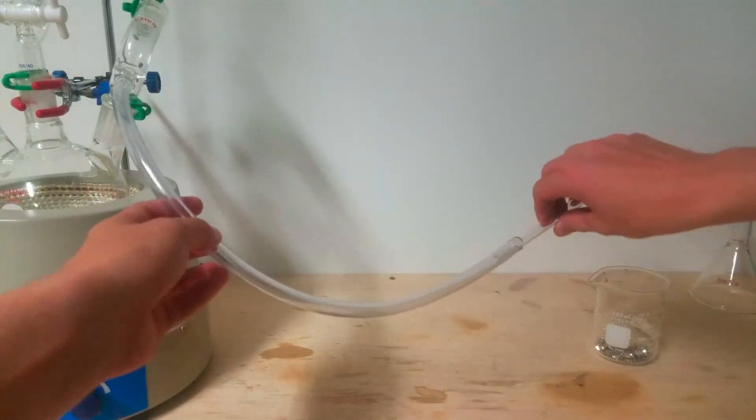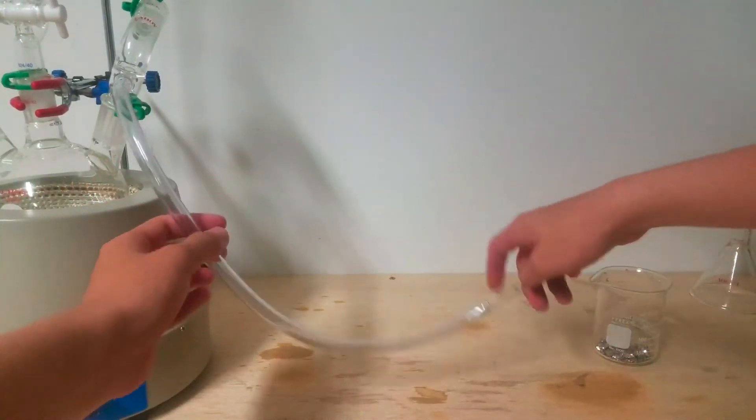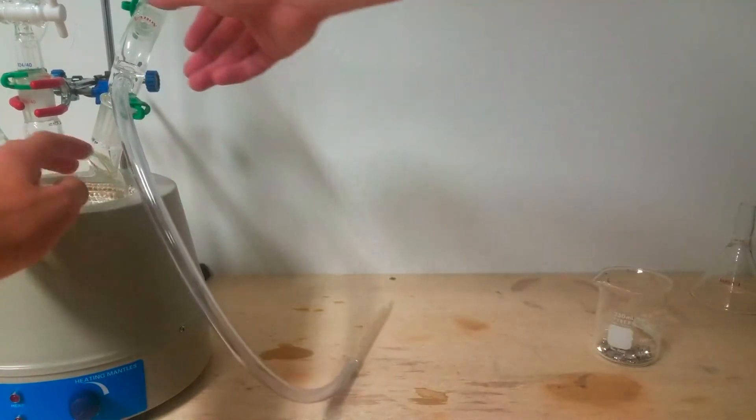I wasn't entirely sure if the tube would react with the acid in a negative way, and I didn't really want to go look it up, and I didn't want to risk finding out. So, I decided this was 100% the way to go.